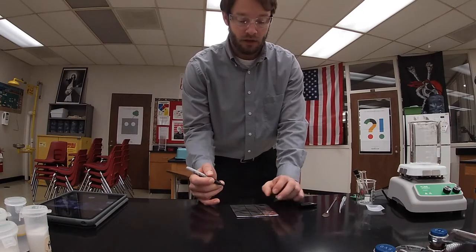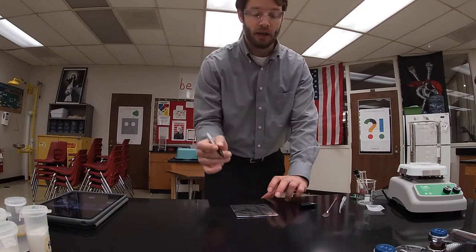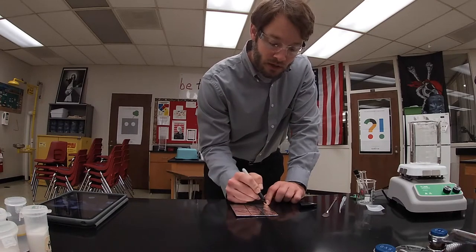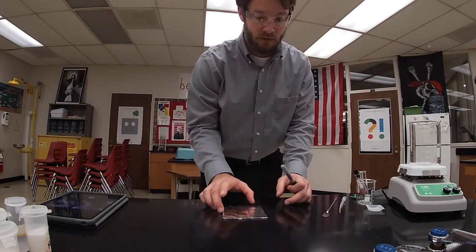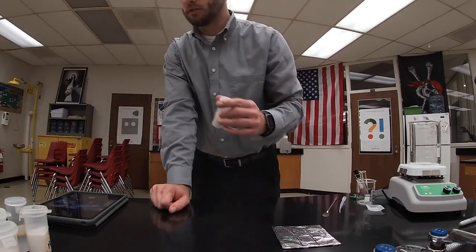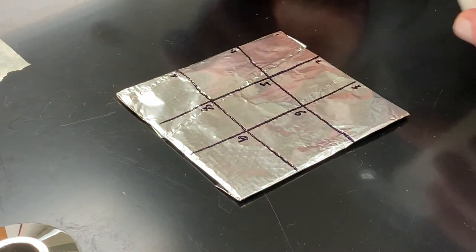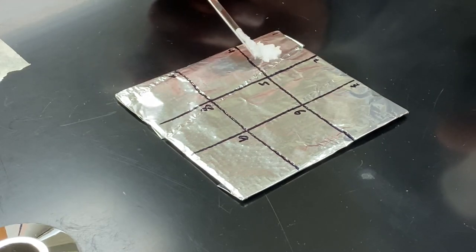I can then label my substances. If I were to number my substances one through nine, I can then have these squares numbered so I can keep track. I have my squares numbered. Next, I want to distribute my substances on this grid. The first substance I have is paraffin — the more technical term for wax. I only need a little bit.